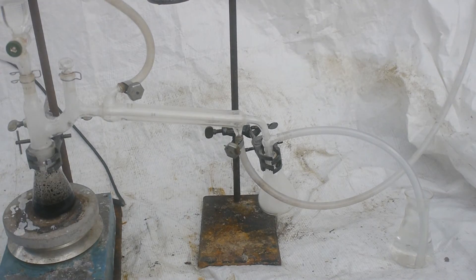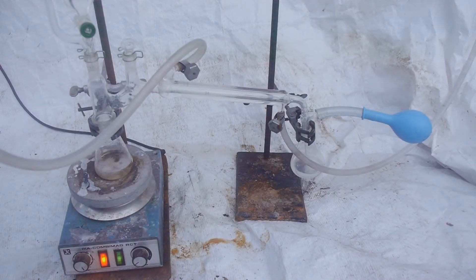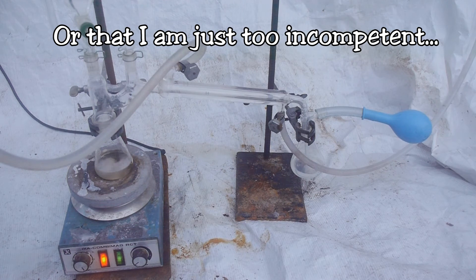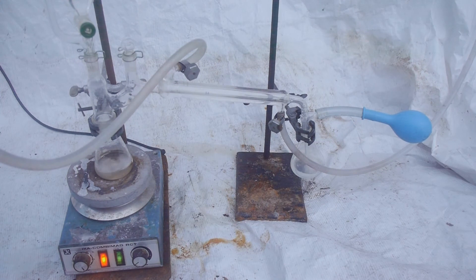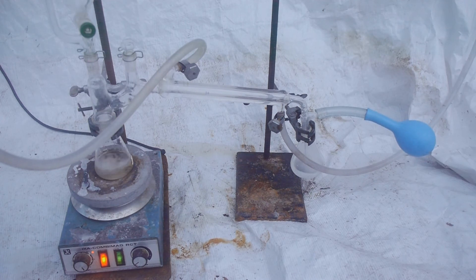The next step is to fill a balloon. The side product is sulfur dioxide. I don't think either sulfuric acid or phosphoric acid are suitable catalysts for making ethylene, but at least I've proven the point very well that it's very difficult — a lot more difficult to make ethylene than acetylene. At least I've achieved the main goal and made some flammable dry ice. Let's drop in all the ethanol at the end and see what happens — that didn't really produce a significant amount more and nothing really exciting happened.